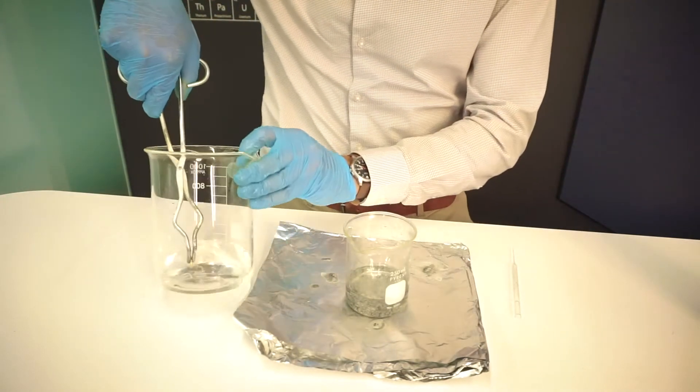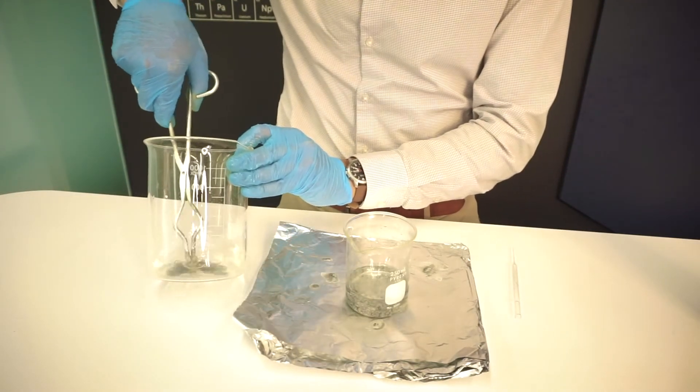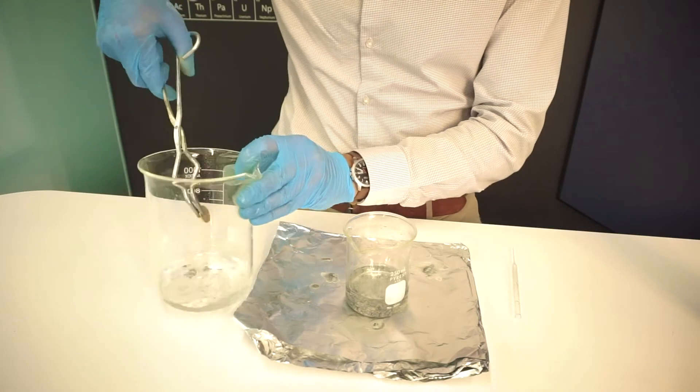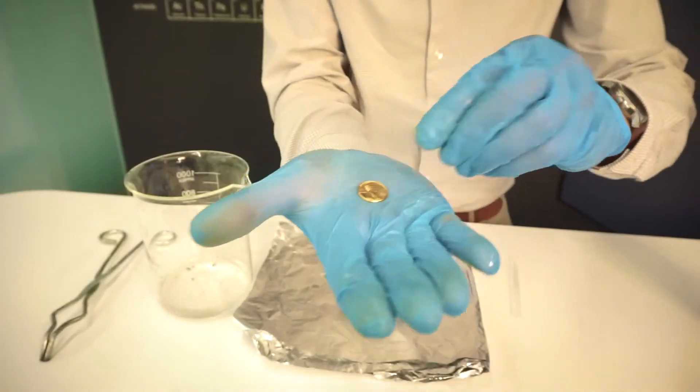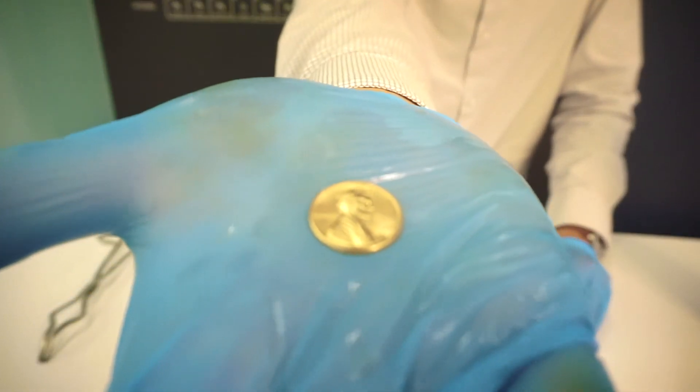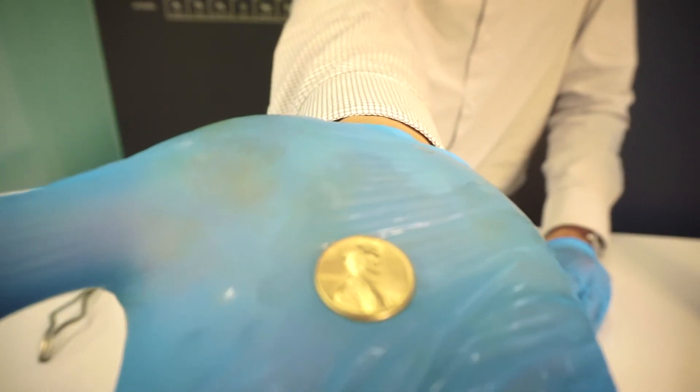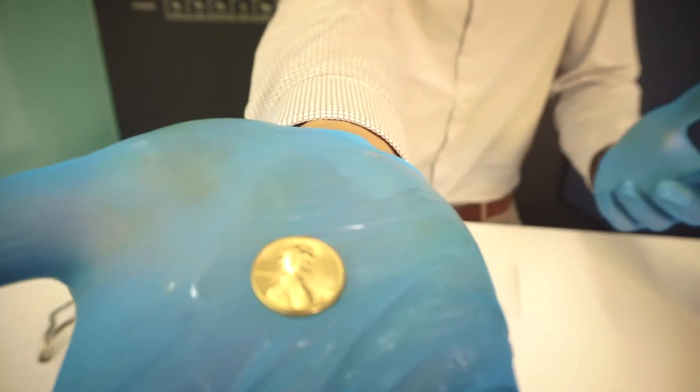Cool it down in the water. Wash it off again so I can show you. And so you can see now it has a brass color. And indeed we've made brass. It's a nice golden color.